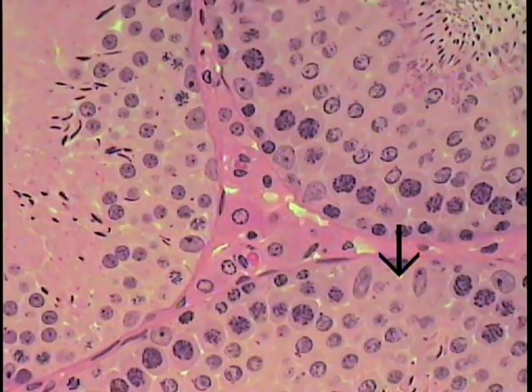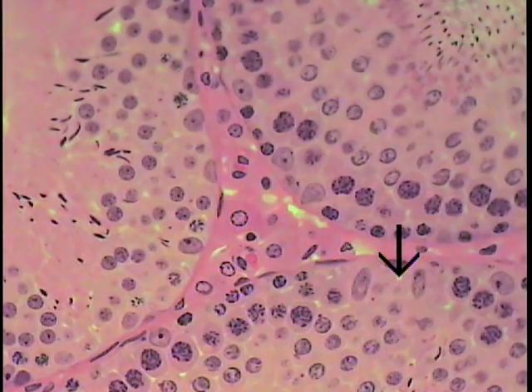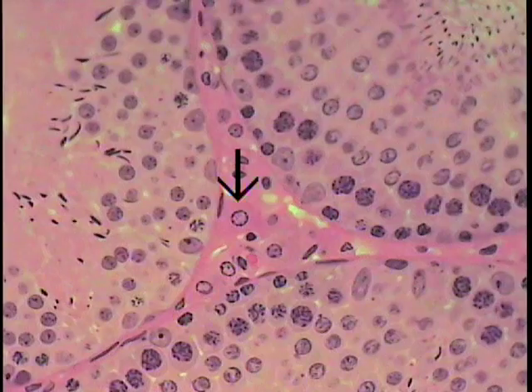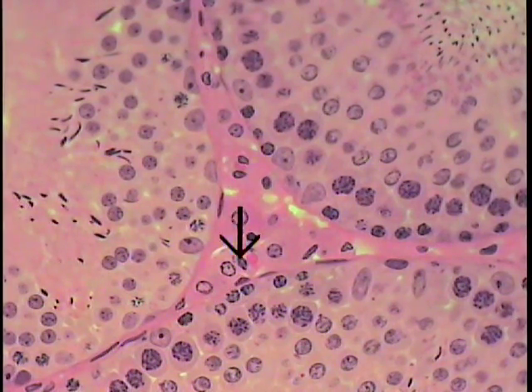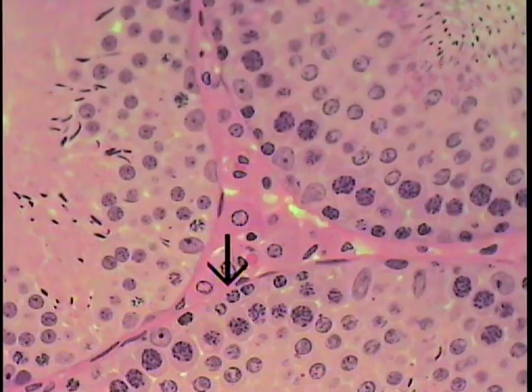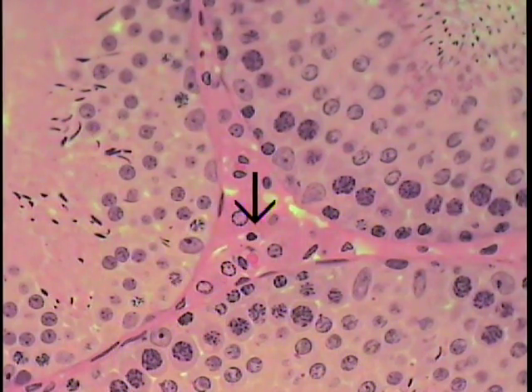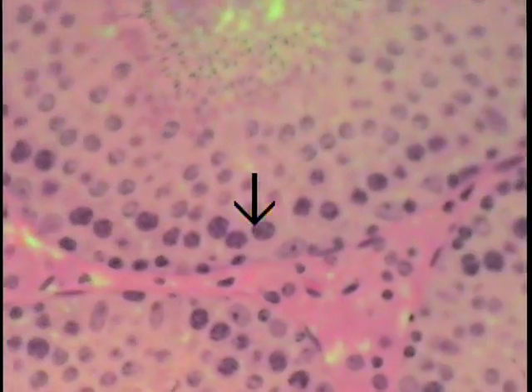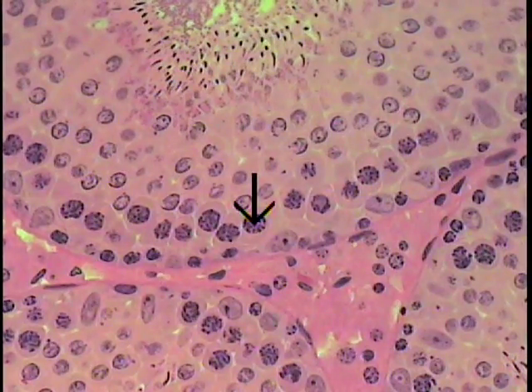Now if one courses around, perhaps here they are a little bit better separated and more easily visualized. This large cell here is a Leydig cell — try to trace it with its central nucleus. This large cell here is a Leydig cell, and this one here. It's absolutely critical that these cells be located in the interstitial tissue; otherwise, you're dealing with another cell type.